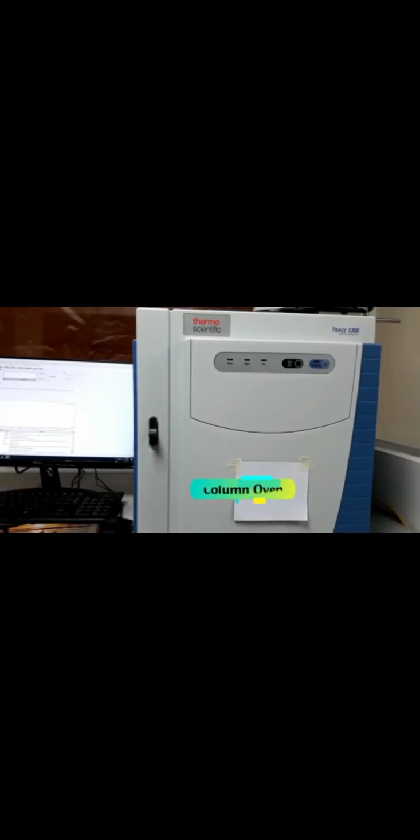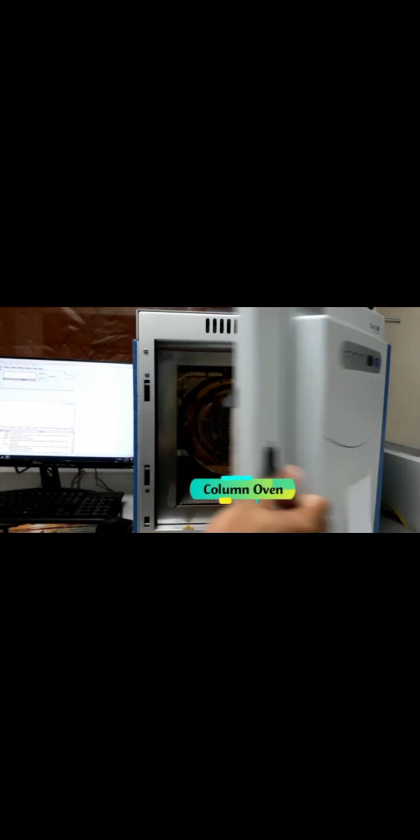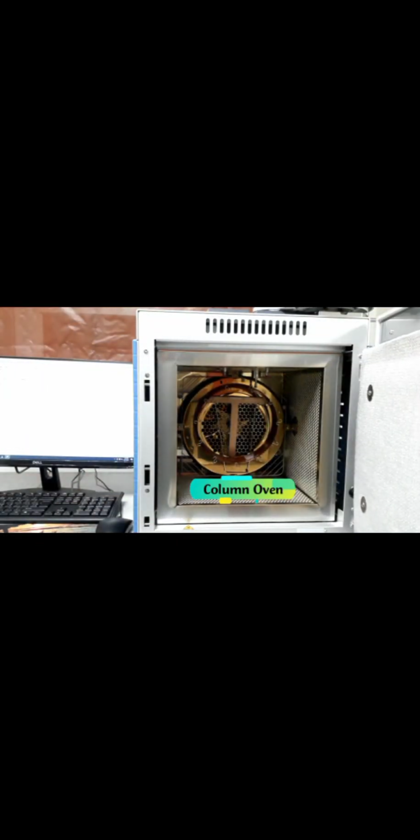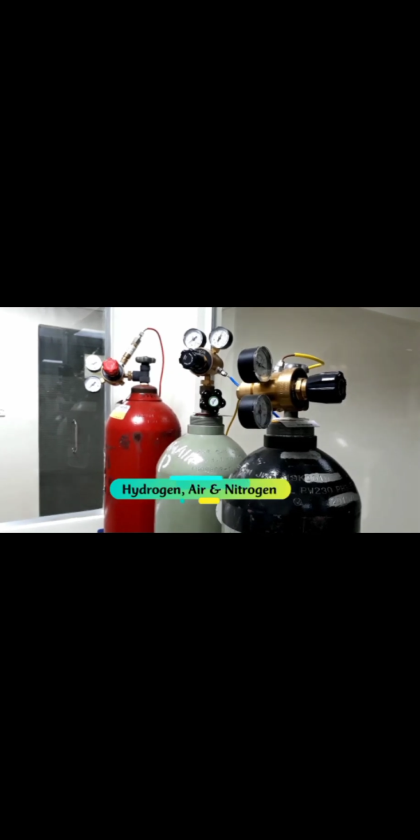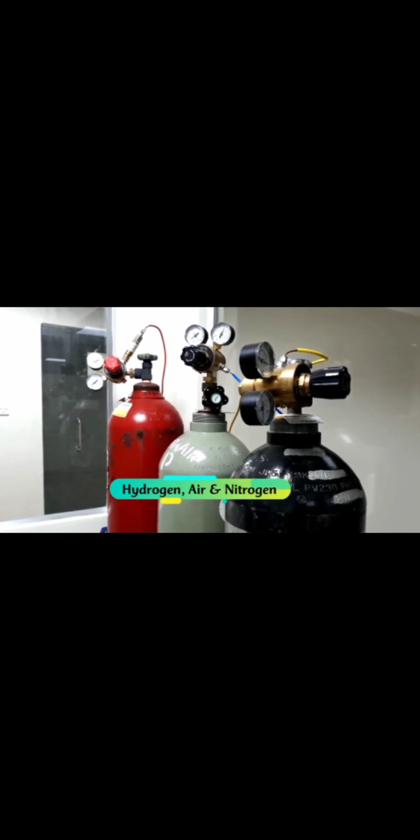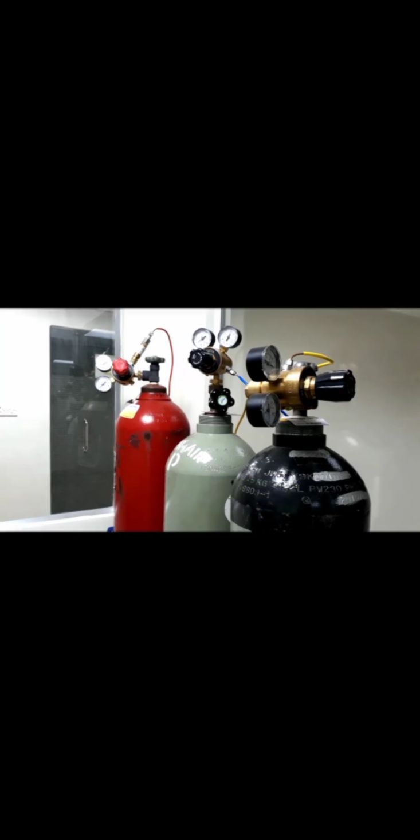A gas chromatography involves a detector, an autosampler which is used for taking and injecting samples, a column oven, and a source of gas which is mainly hydrogen, air, or nitrogen. As the name implies, the gas chromatography is mainly used for fatty acid composition tests, to check for pesticide residue, food additives, and other analysis.